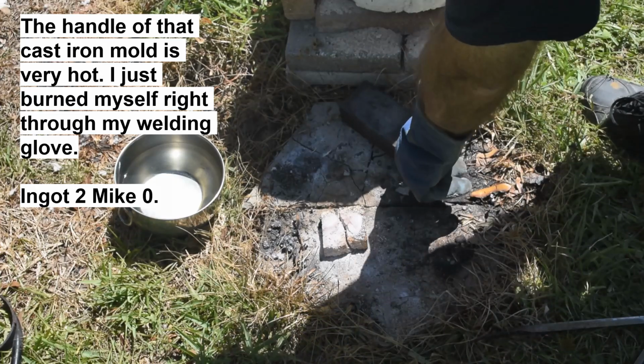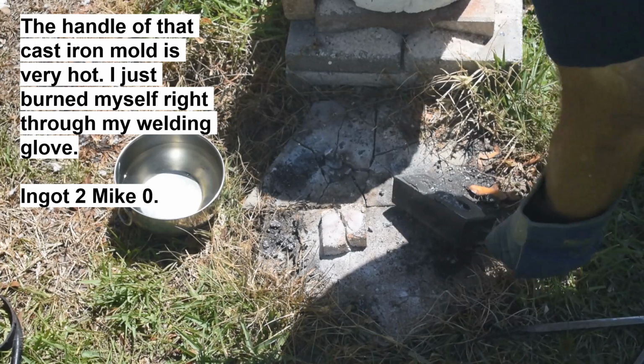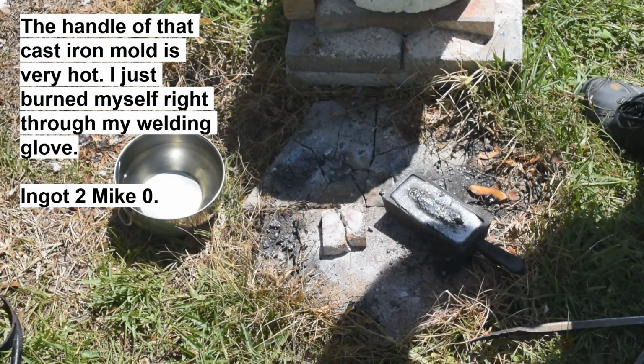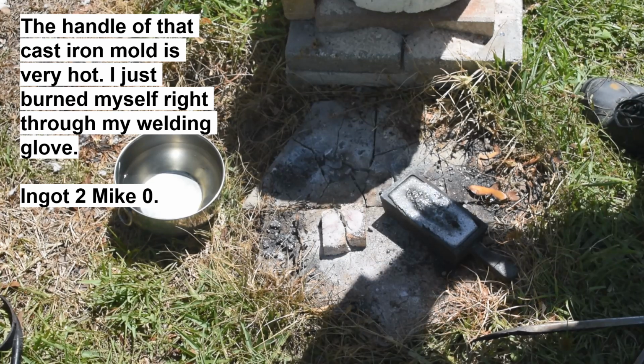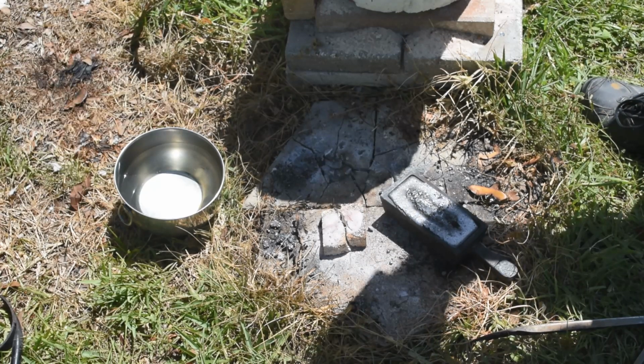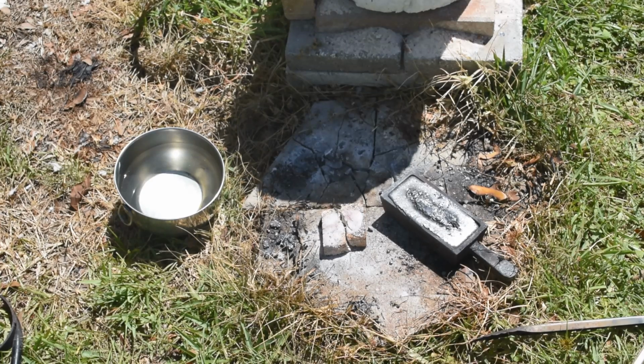Okay. Yeah, I'm just destroying the concrete here. But that's not really coming out. Huh. Let me let it cool a little bit, maybe differential contraction between the cast iron and the copper. Maybe it'll break itself free.